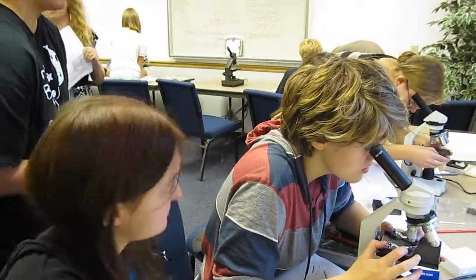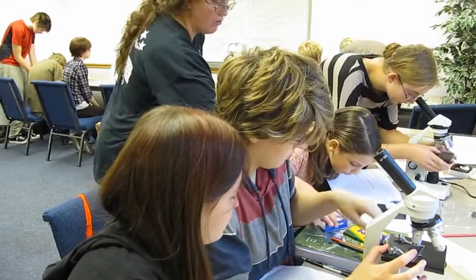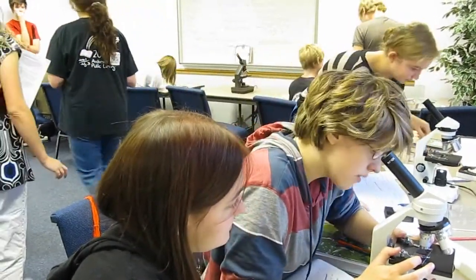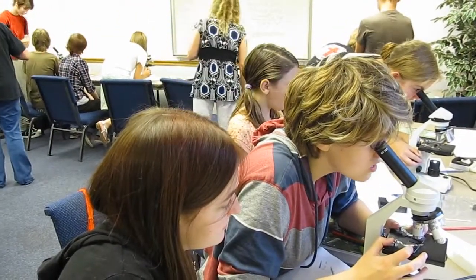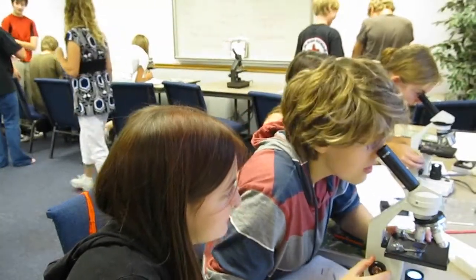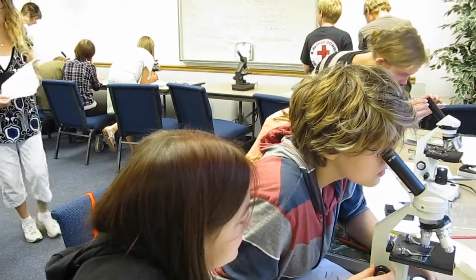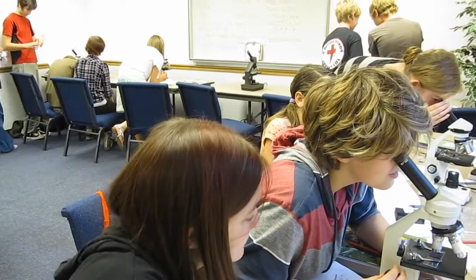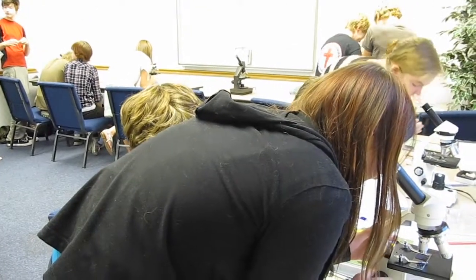We found them at the lower magnification. Okay, where's your big thing of slides? Give me that one. It's never a failure because you learned something. Here's a flat slide, you can take a try. It's okay, I have two.